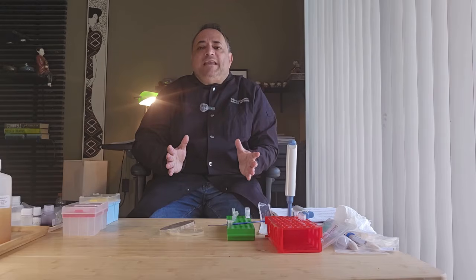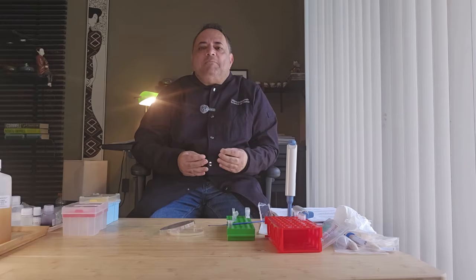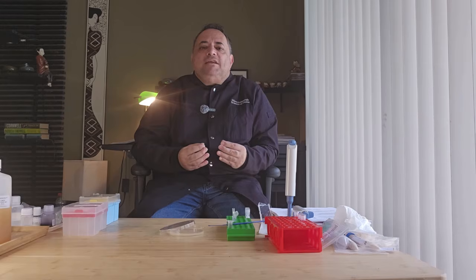In today's video, I am very excited to be able to bring to you and to demonstrate the CRISPR-Cas9 molecular biology gene editing technique. Yes, you heard me correctly. We are going to perform a CRISPR-Cas9 reaction.